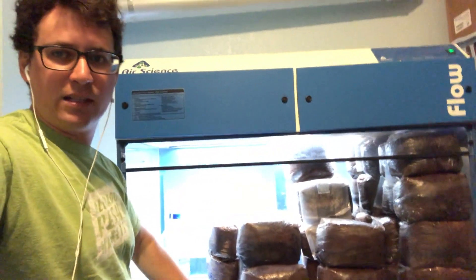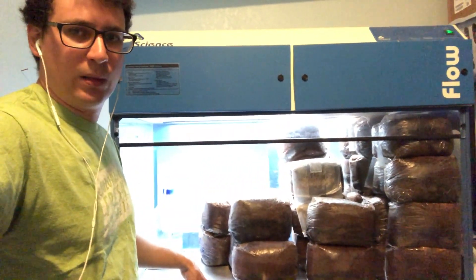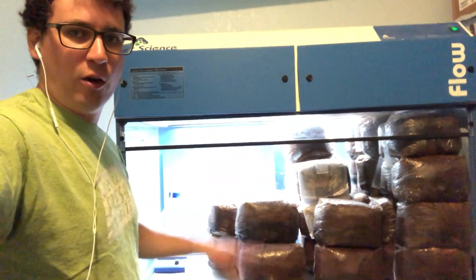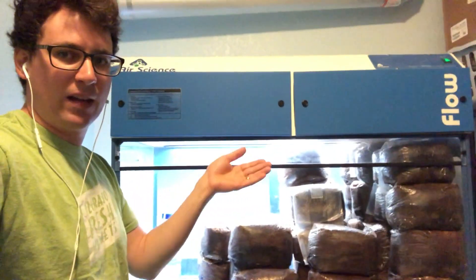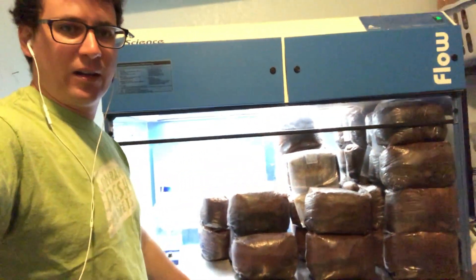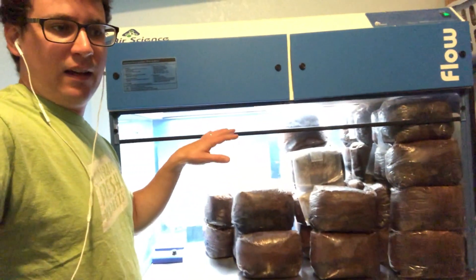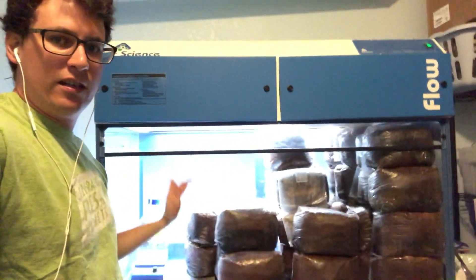Shout out to Lion's Mane — I sell a mix of my locally sourced substrates over there, and you just have to add water and sterilize it for 90 minutes. These bags have all been sterilized and we'll be inoculating with my grain spawn that I inoculated two weeks ago.